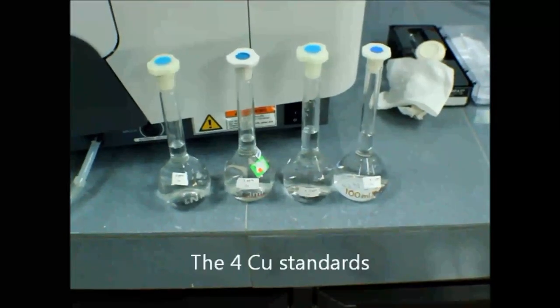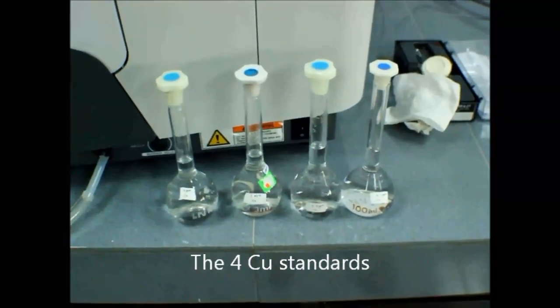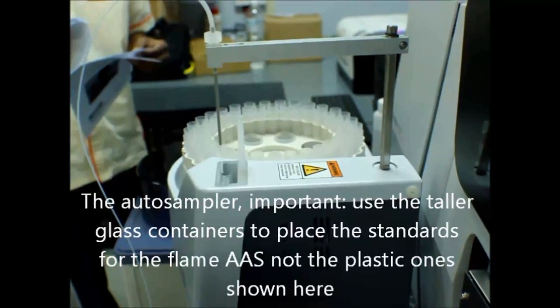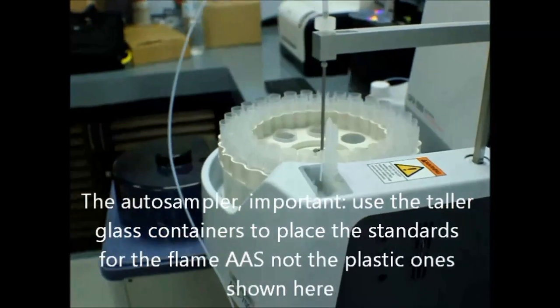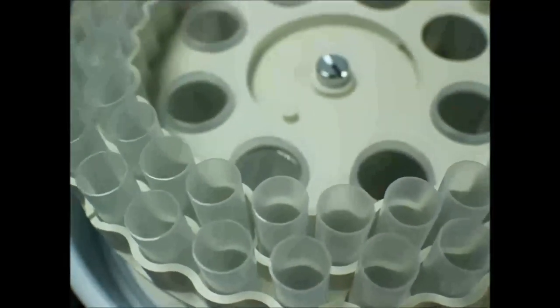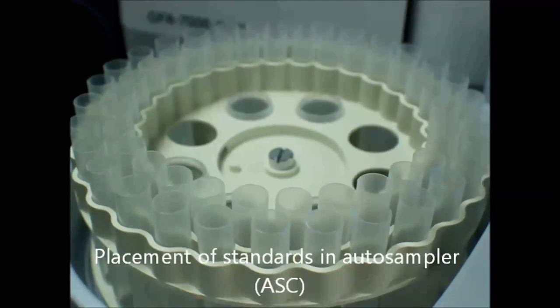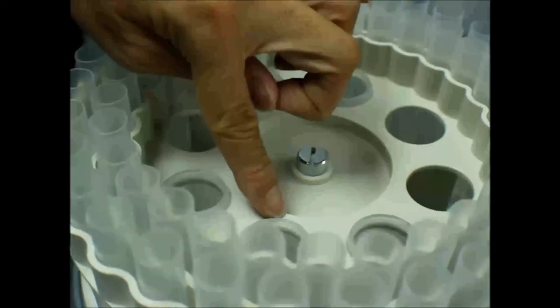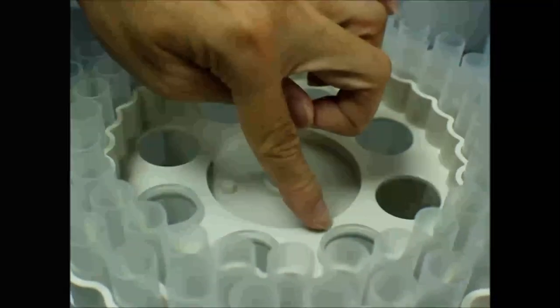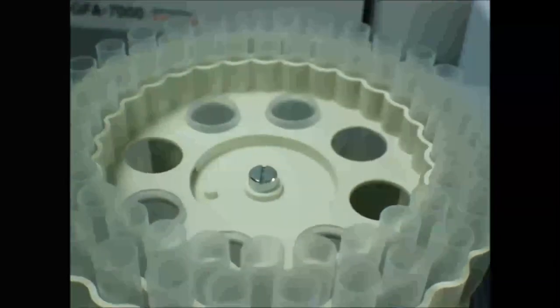Hurry. I think we better change a new one. Dalam ni ada AAS. It goes up like 0.1, then 0.2, 0.5. Okay, increase. Lowest means 0. Blank. So I put in R1. Then R2 I put higher. 0.1. Then this one I put 0.5. Then this one I put 1 ppm. This one is 2 ppm. So that means I have 5 points on it.